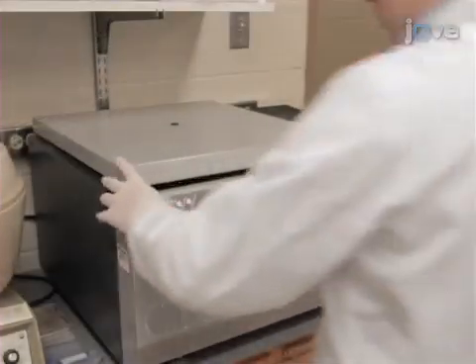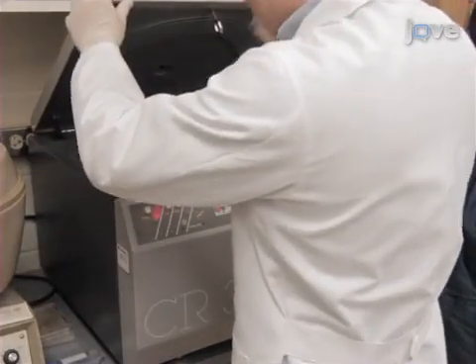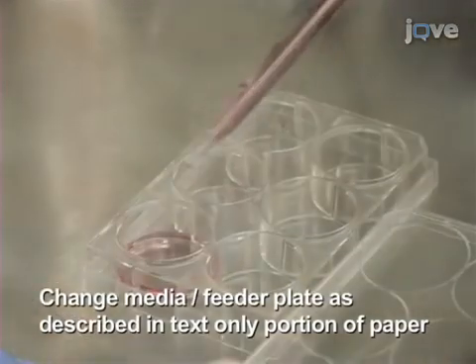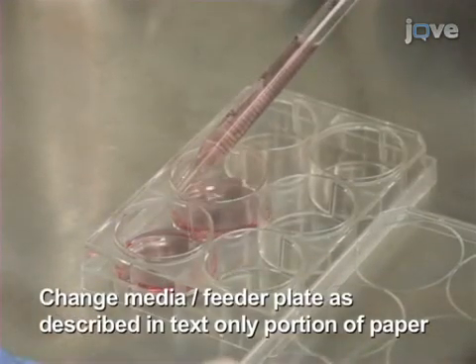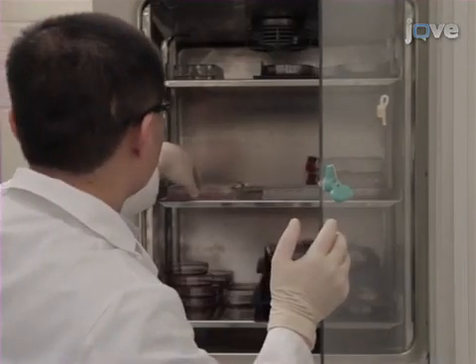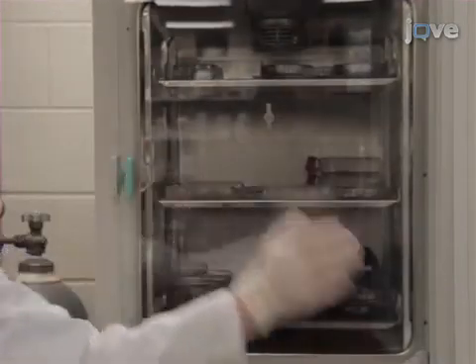On day 8, gently pipette down the loosely attached cells, centrifuge the cells, and then transfer the cells to a single well of a 6-well culture plate coated with confluent OP9DL1 cells. Incubate the cells at 37 degrees Celsius, 5% carbon dioxide for 2 more weeks.